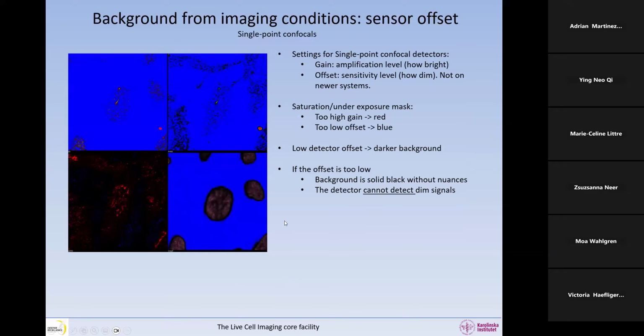And so if you set the offset too low, you are preventing the detector from detecting weak signals. So not only here, but also inside the cells. So don't have that. We do not want to have any underexposure in our images. This cannot be fixed after acquisition. You're just preventing the detector from acquiring.